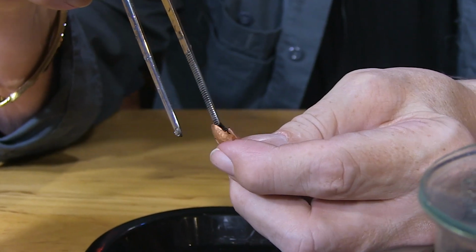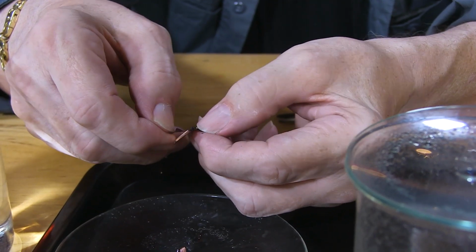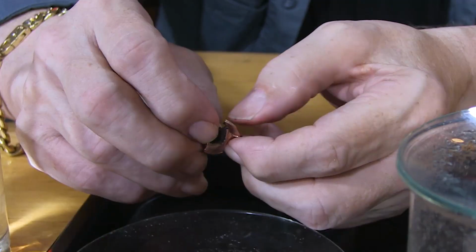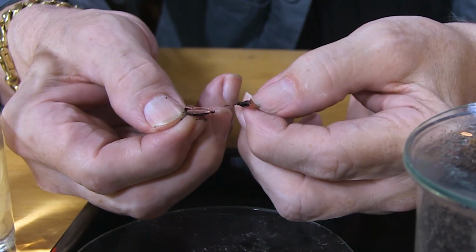Spread that apart a little bit. Yeah, look at that. I can get down inside that penny. Zinc is just about gone. There's a little bit of zinc still in there, so I better let it cook for another hour or two. You can tell that it's all eaten up inside. Look at that.